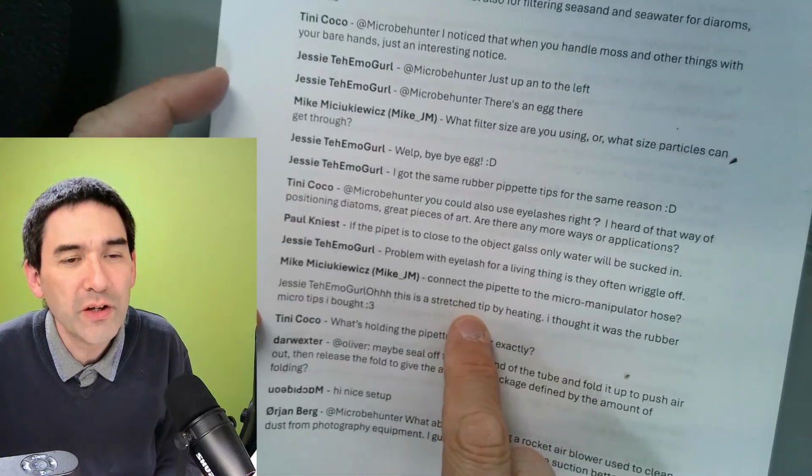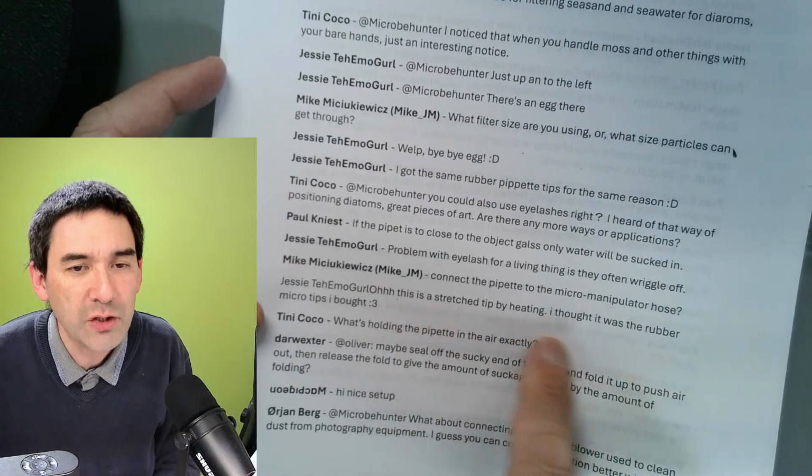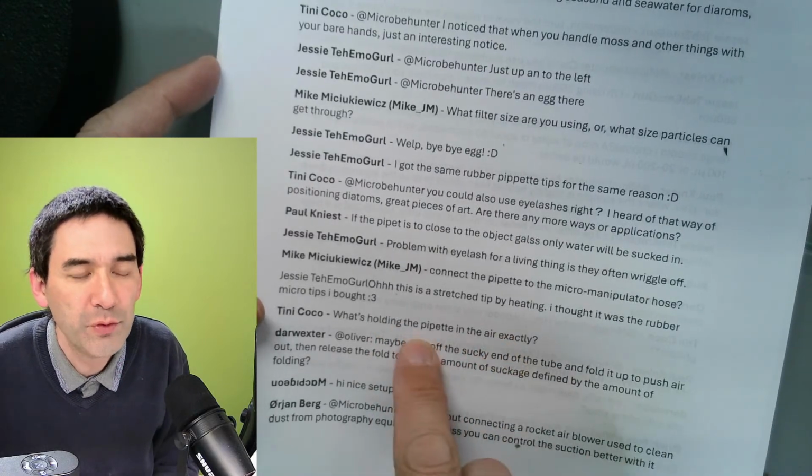Yeah, that's a stretched tip by heating. I thought it was the rubber micro tips I bought. No, it's actually just the disposable plastic tips that I have. Yeah. Okay, what's the holding? That was my microphone stand.